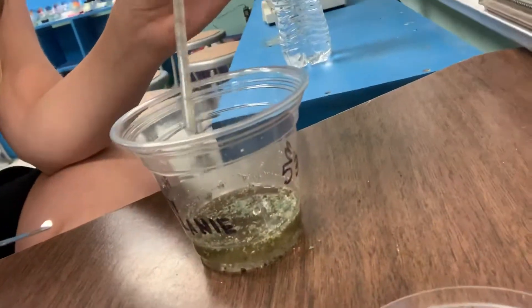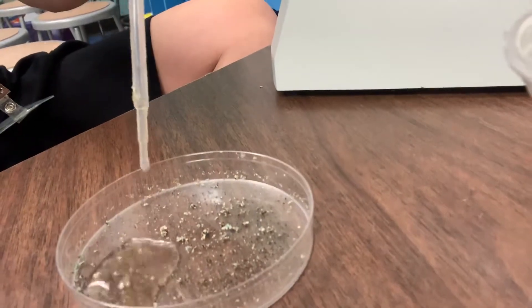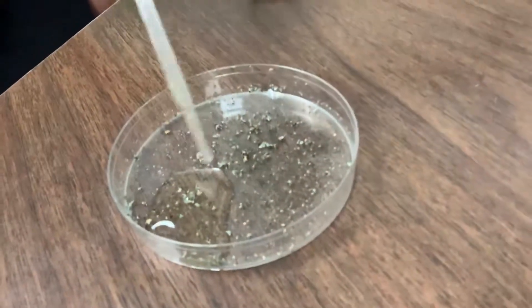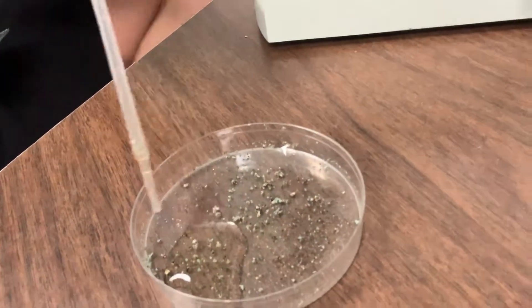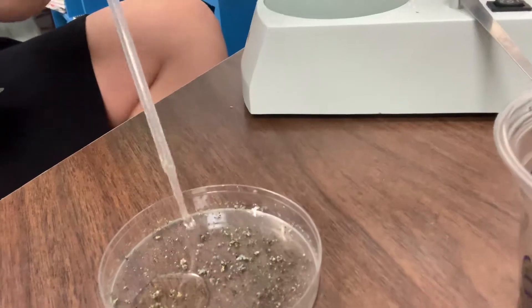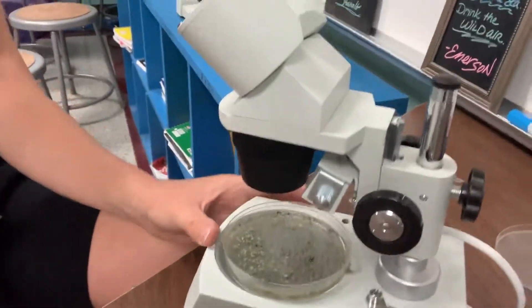Vacuum from the bottom because water bears are more dense than water. So once you have that, you're going to squirt it into your petri dish. Notice how I don't have it all the way full — I need to fill it all the way up. This is why I prefer to use a smaller petri dish, because then one squirt would fill it entirely. Just squirt it all the way until it's full, making sure you've got plenty of stuff in there, but not the big ginormous stuff. Then place it under the dissecting scope.